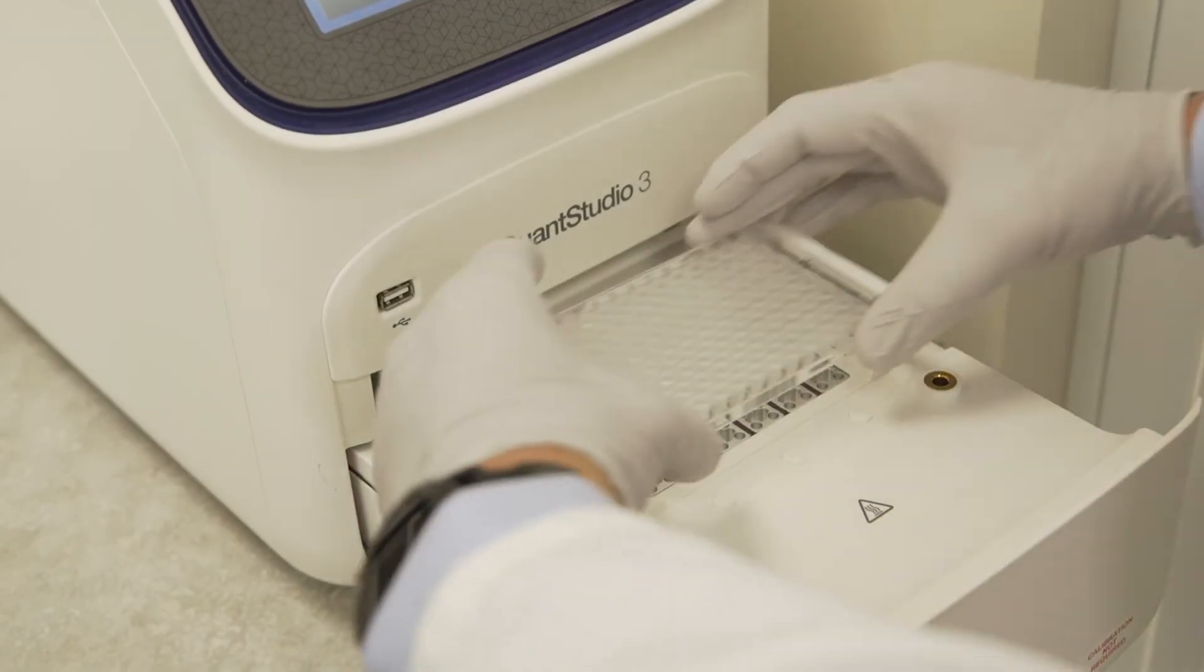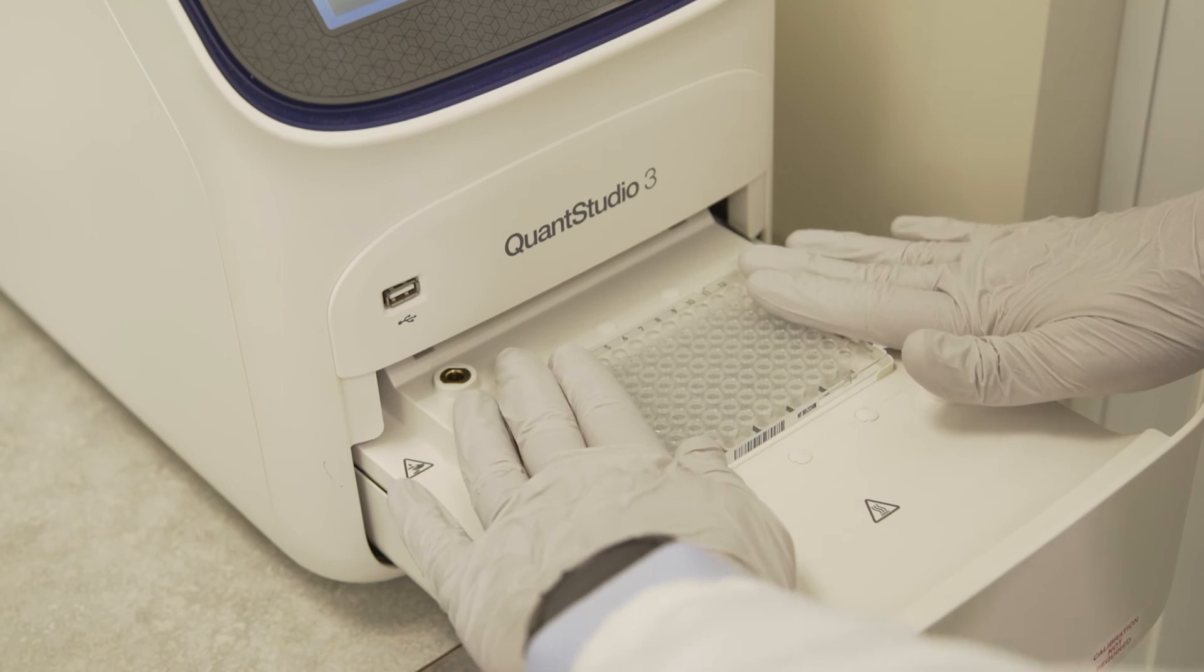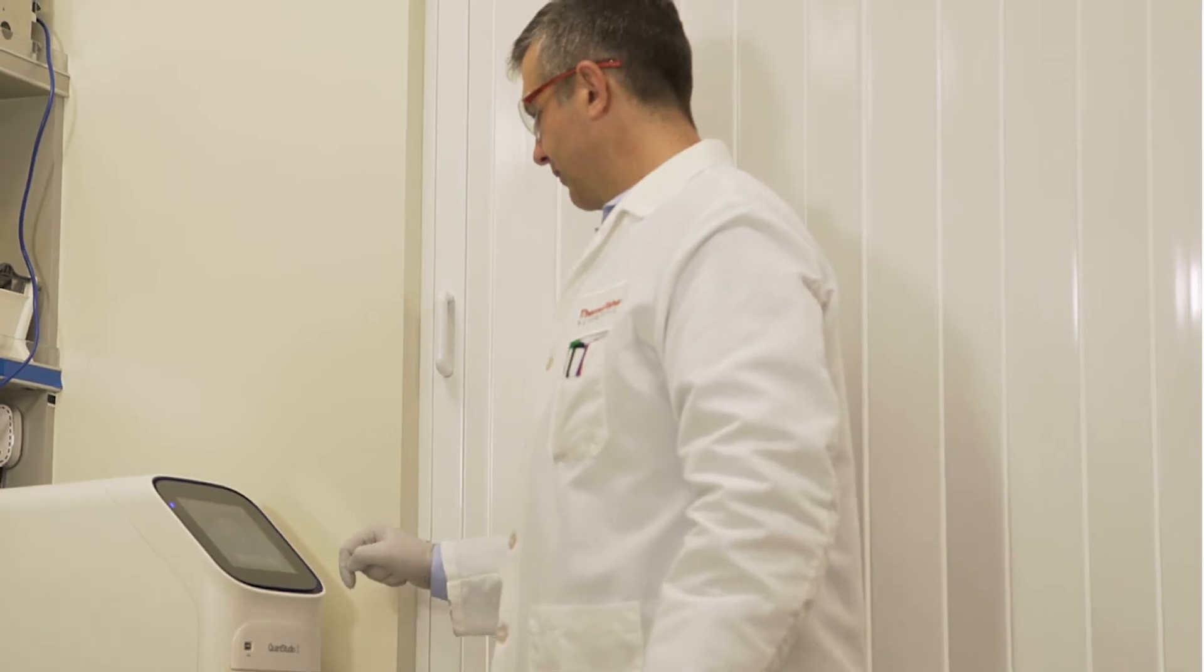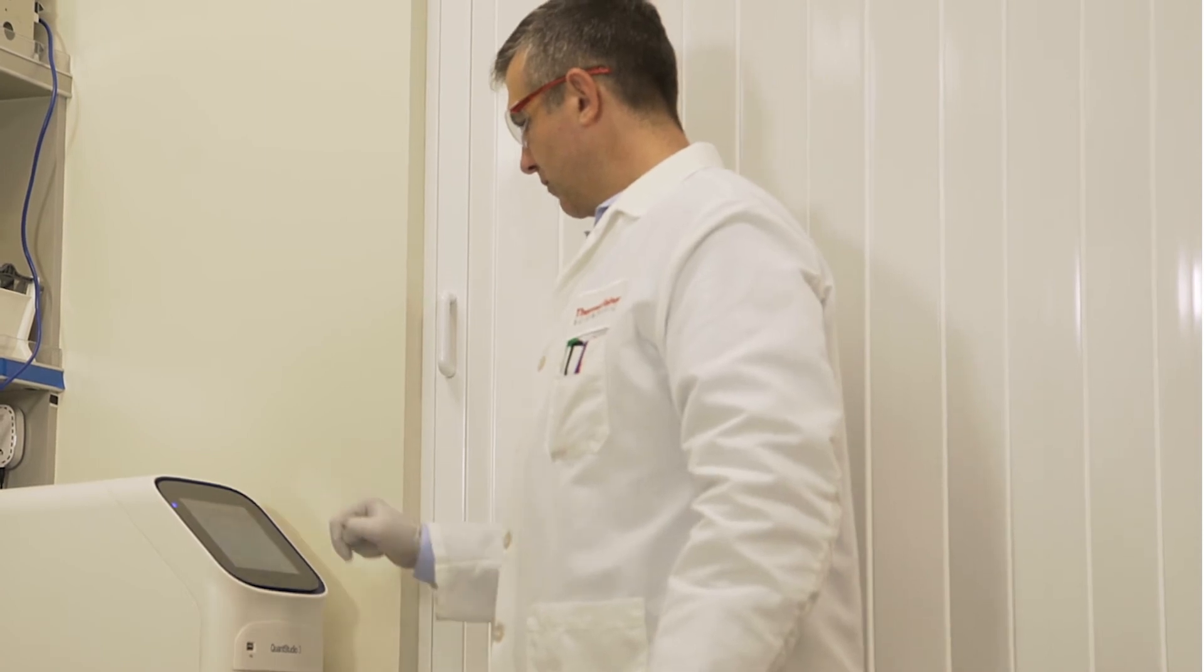Place the plate into a qPCR instrument. Set up a one-time ProQuantum template to collect all CT values as unknowns according to the instructions in the kit protocol.